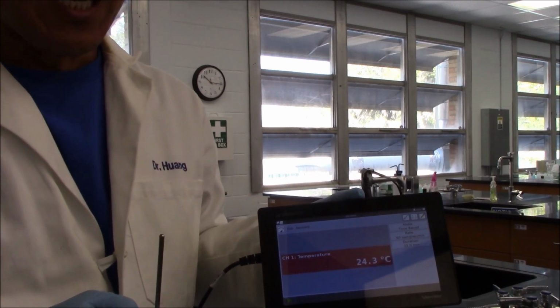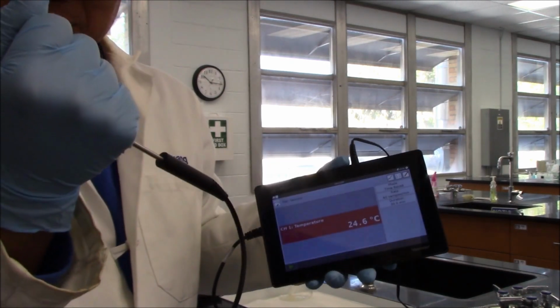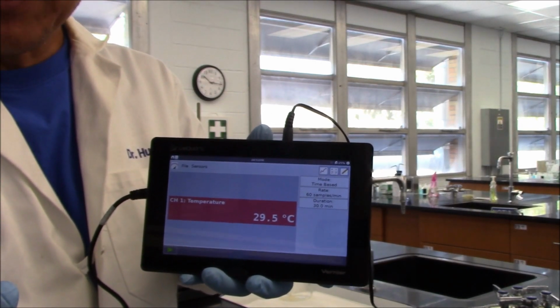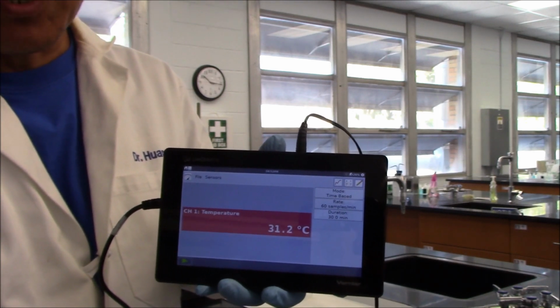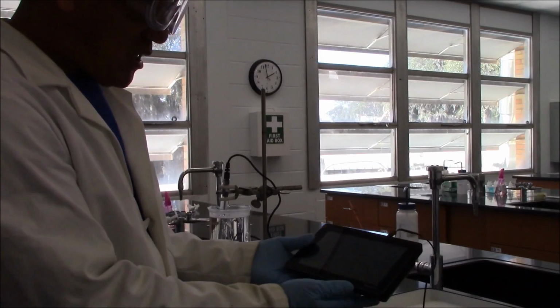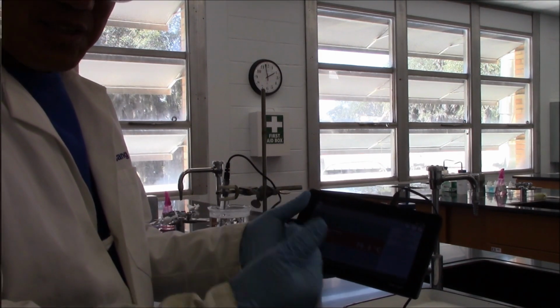As we know, our body temperature is higher than the room temperature. Therefore, if you use your hand to hold the temperature probe, the temperature reading should rise. If it's rising, that means the device is working properly. If it's not, there must be something wrong, either the temperature probe or the LabQuest. Good luck. When the temperature reaches about 70 to 80 degrees Celsius, we can stop heating, take out the test tube, and proceed to the next step.